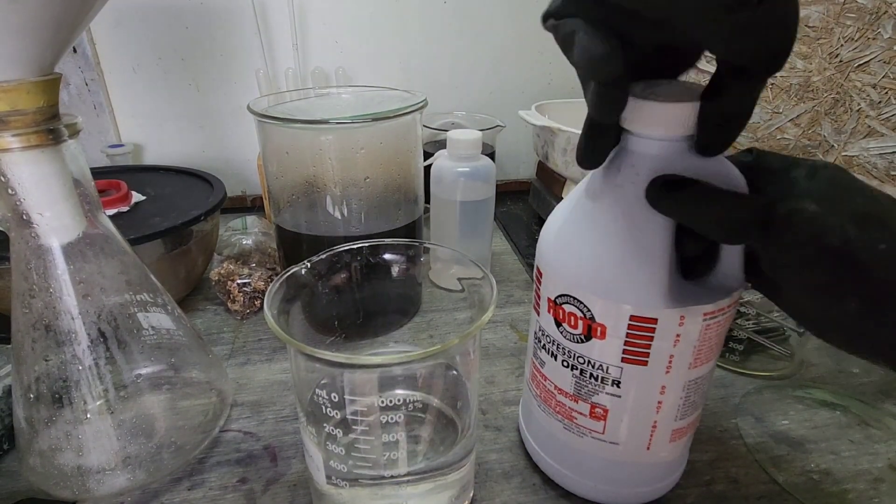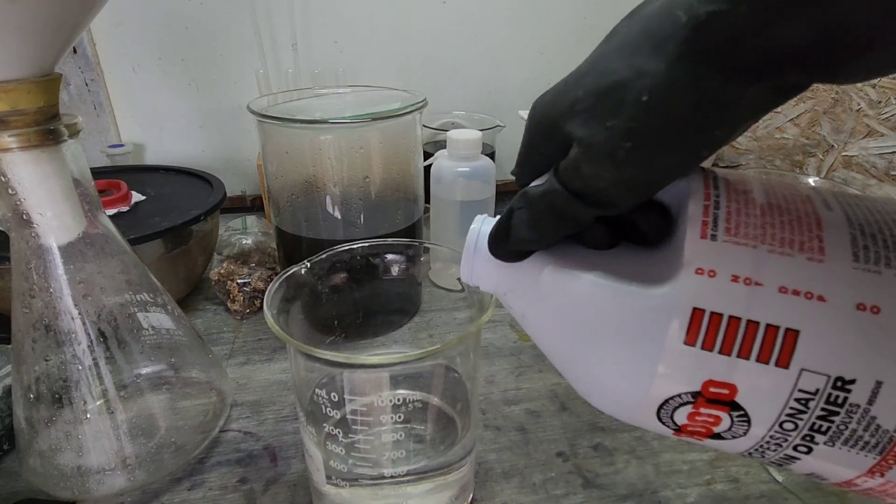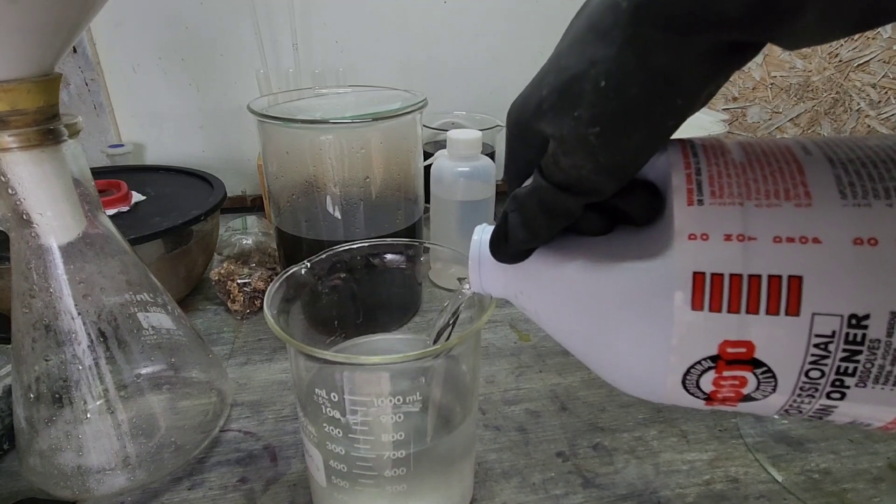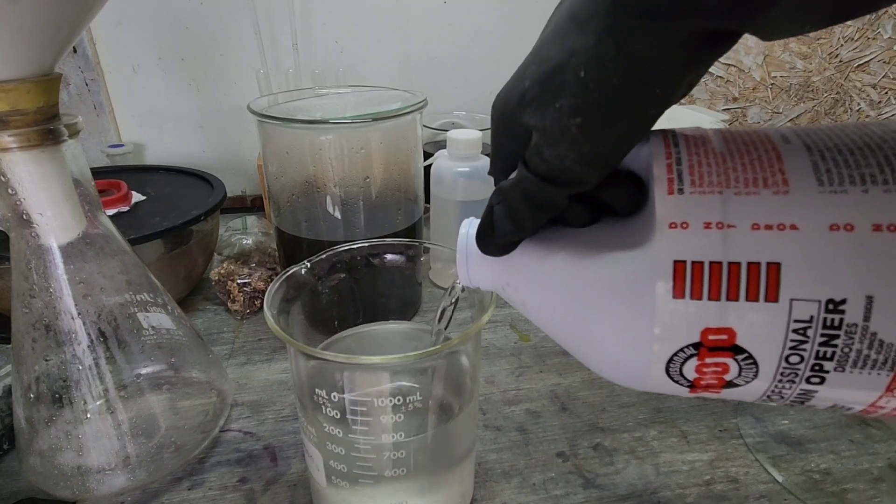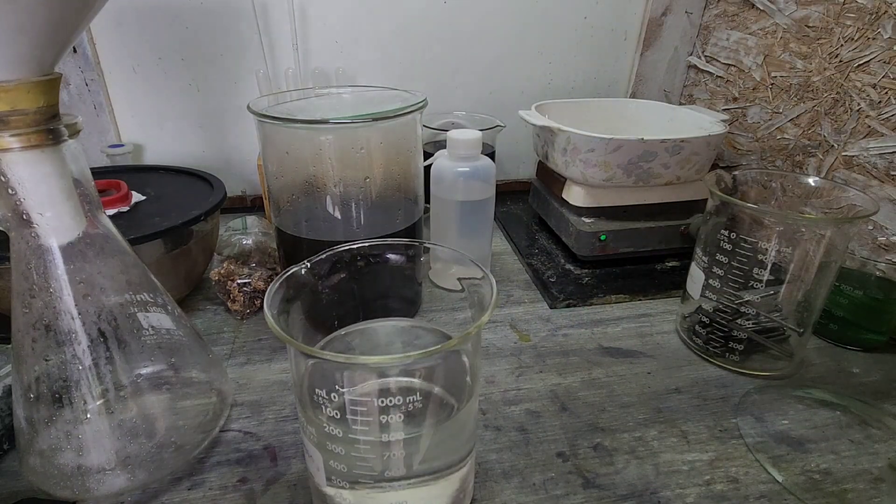Sulfuric acid. We're going to go with 200 milliliters of sulfuric acid.